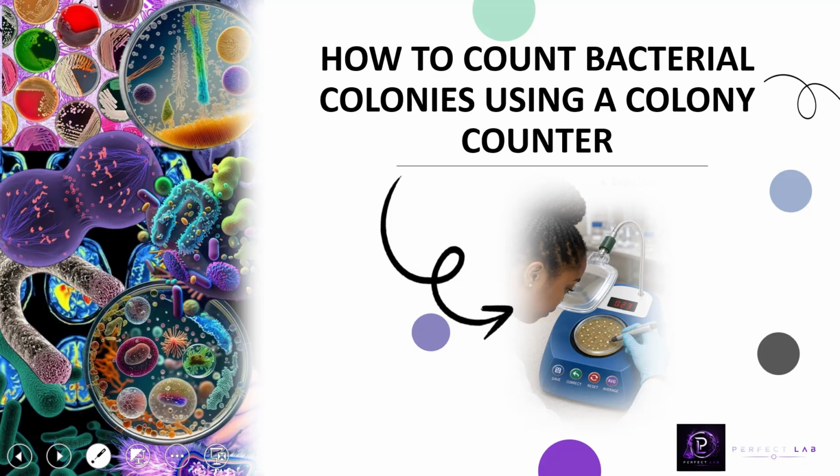We are going to learn how to use the colony counter to count bacterial colonies on agar plate. And I believe by the end of this video you will be able to accurately count bacterial colonies and avoid some common counting errors. So let's get started.